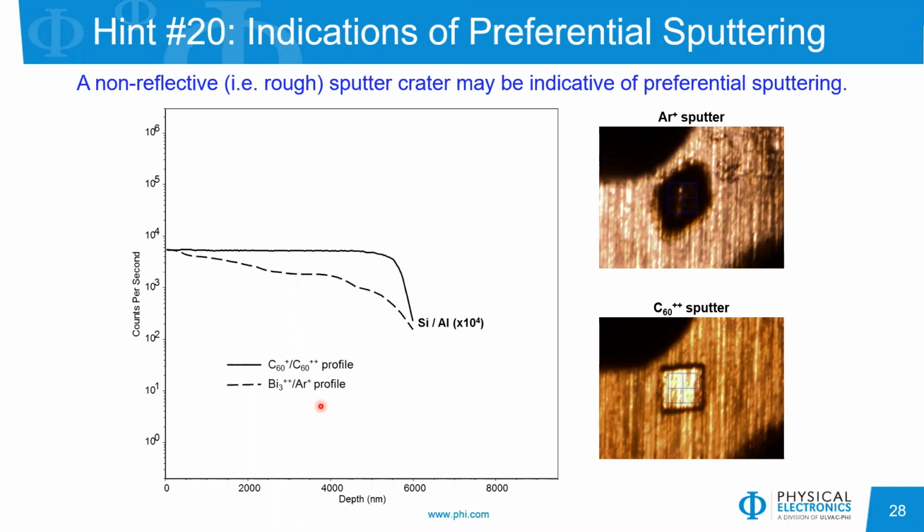But in this particular case, we were looking at a 6 micron thick aluminosilicate aerogel, and we were trying to depth profile that film. The anticipated or expected composition was a uniform silicon to aluminum ratio. And so, of course, our default sputter beam, monoatomic argon, produced this sputter crater that was dark at the bottom, and that depth profile is shown here by the dashed line. And we see that as a function of depth, the silicon to aluminum ratio changes.